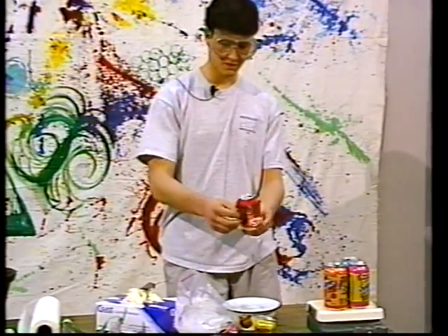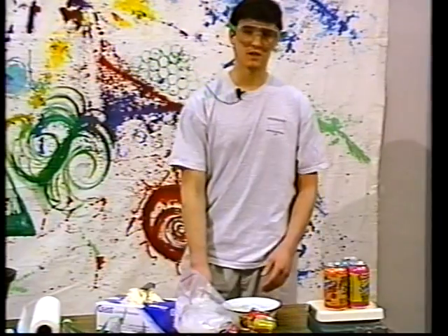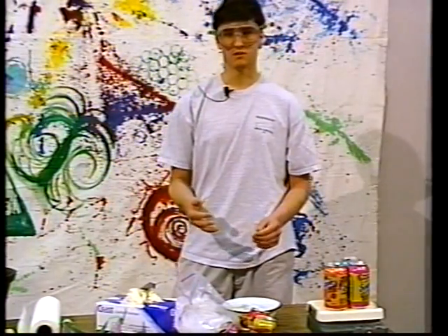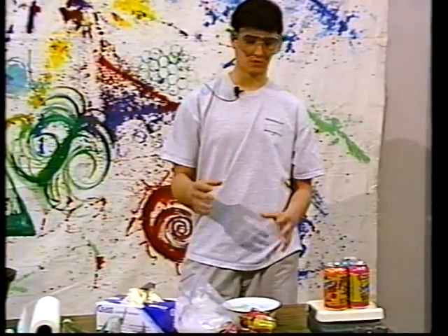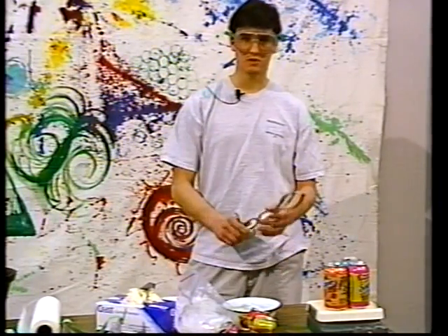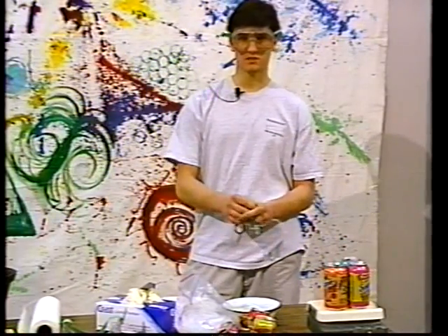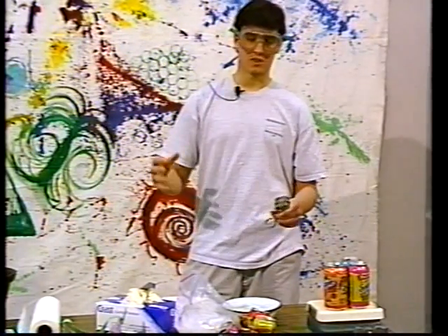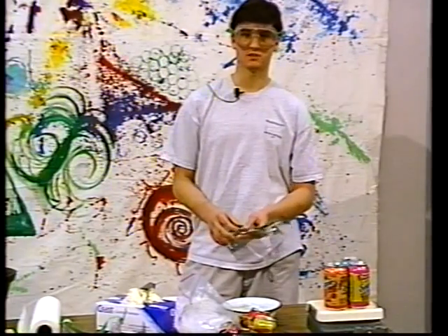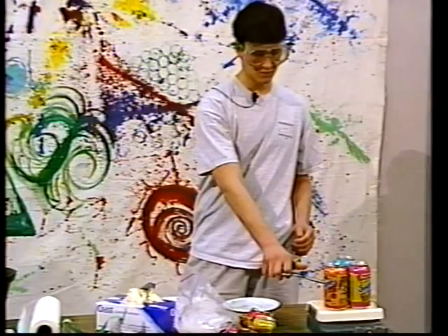What happened here was I had a soda can on this hot plate, and I poured water into the soda can, and inside the can the water started to boil. And when it boiled, the vapor from the water took the place of the air inside the can. When I took the can and flipped it over into the bath of ice, all that vapor that was inside of the can condensed out to the sides of the can, and the pressure from the outside air crushed the can since there was very little air left on the inside. So you'll see it again.